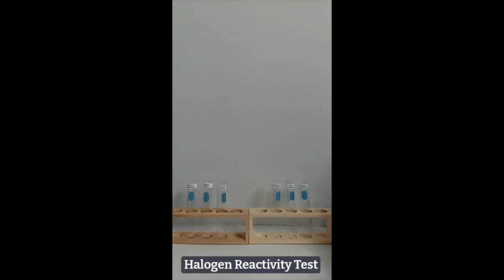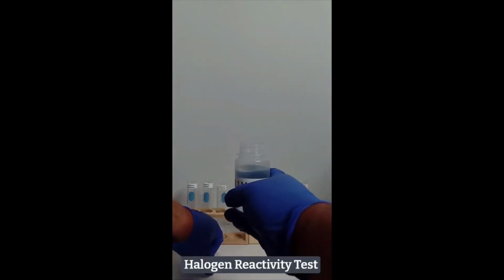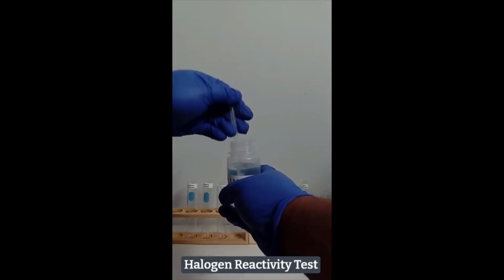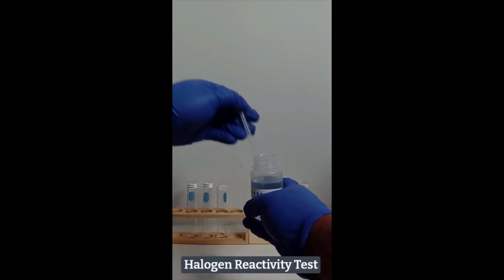Here are 6 test tubes which will be used to compare the oxidizing strengths of the halogens. First, 2 milliliters of 0.1 molar potassium chloride is added to test tubes 3 and 5.